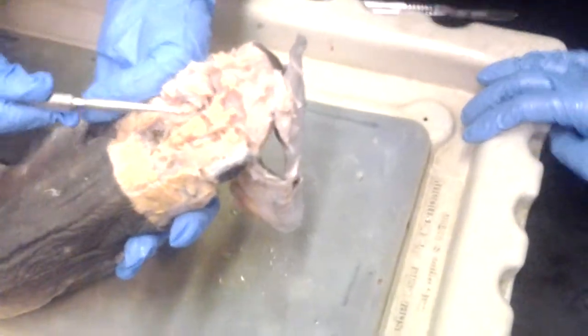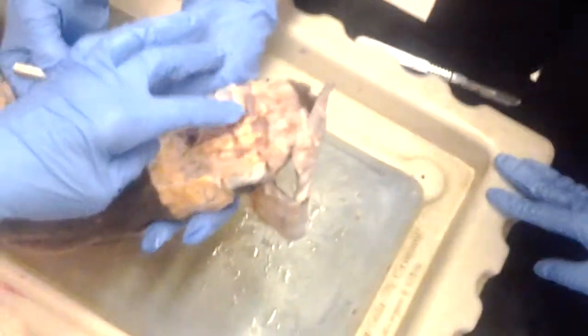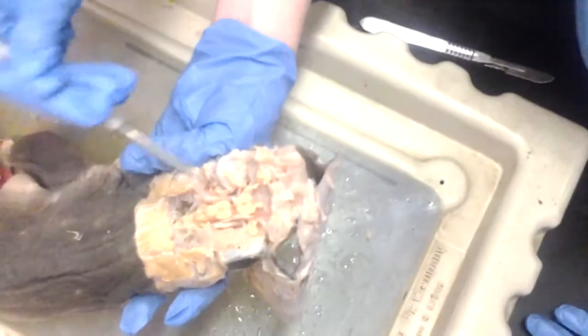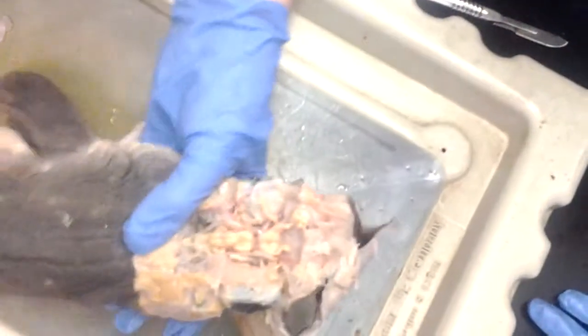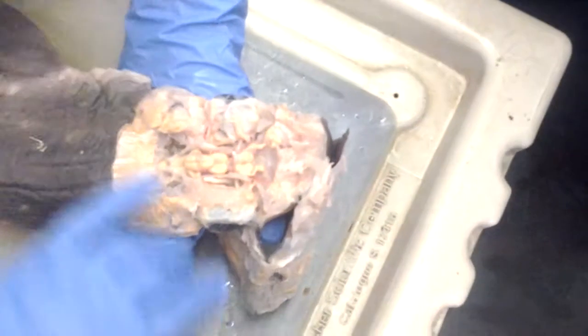So this little thing with the round cup on the top. It was underneath, you have to just pull it out a little bit. And then what is this area? Okay, so this is the eyeball here. So this is the optic pedestal with this little cup on the top right there. And that's the optic nerve, you said? Yes, the white is the optic nerve.